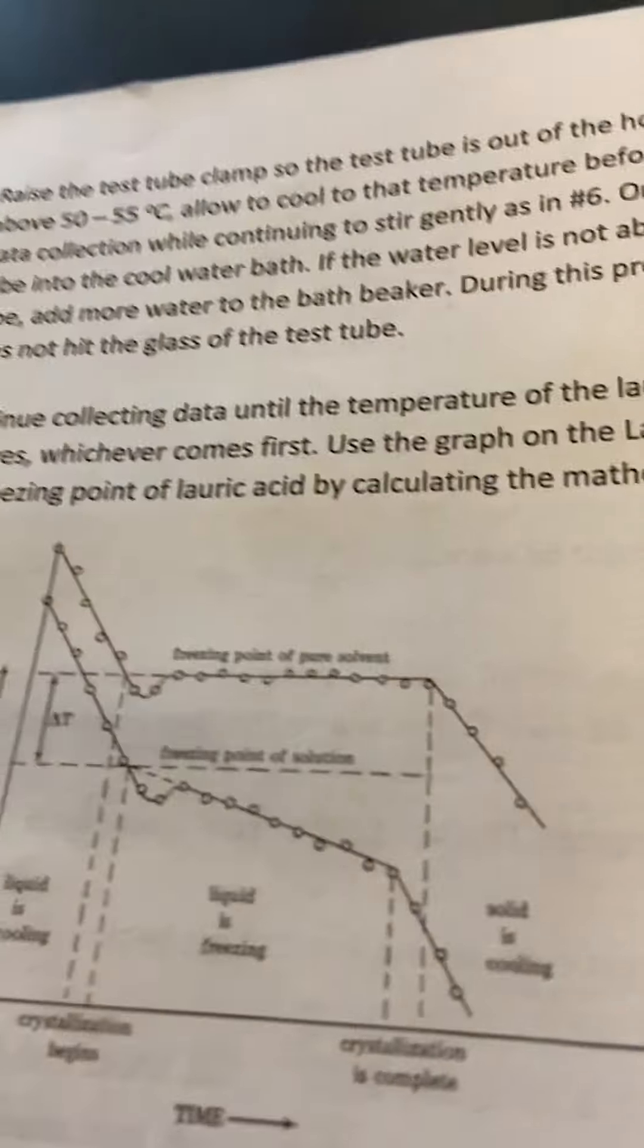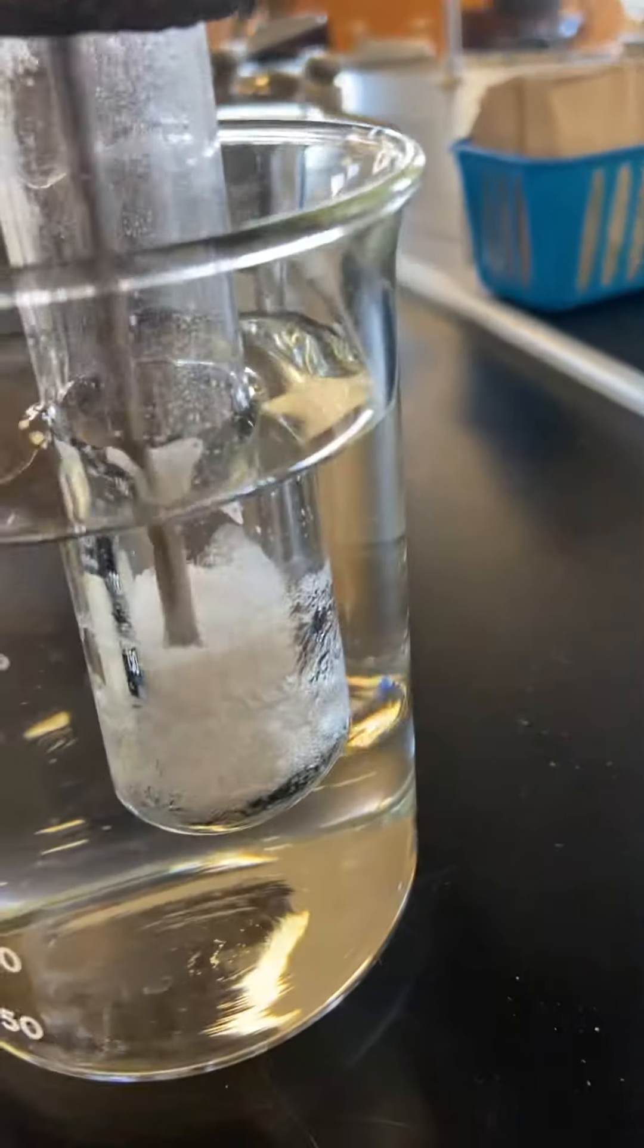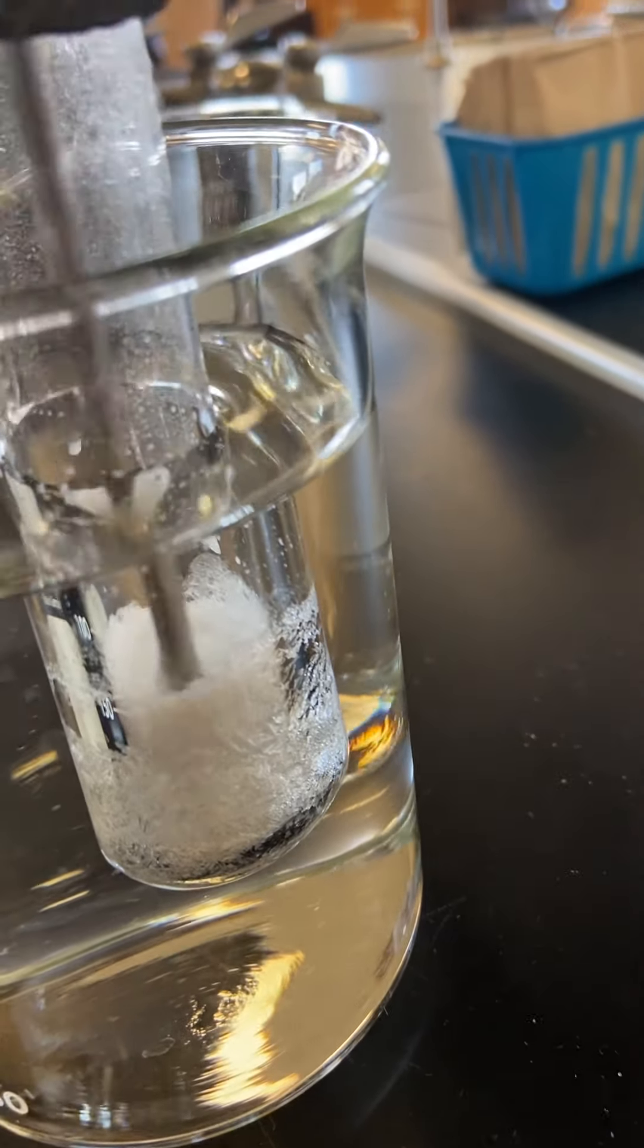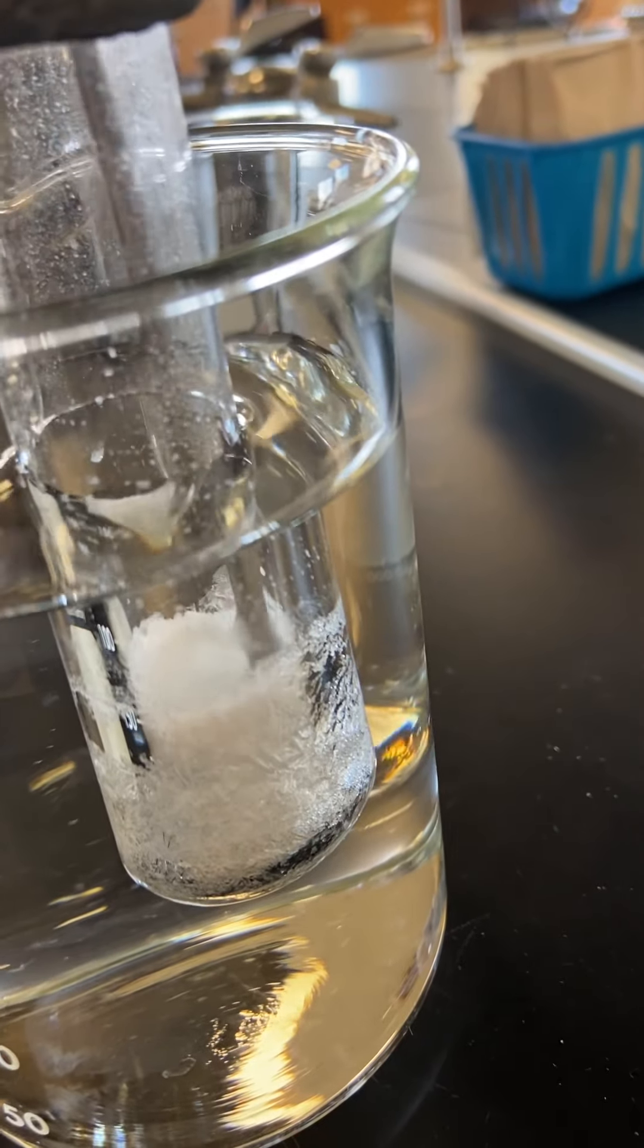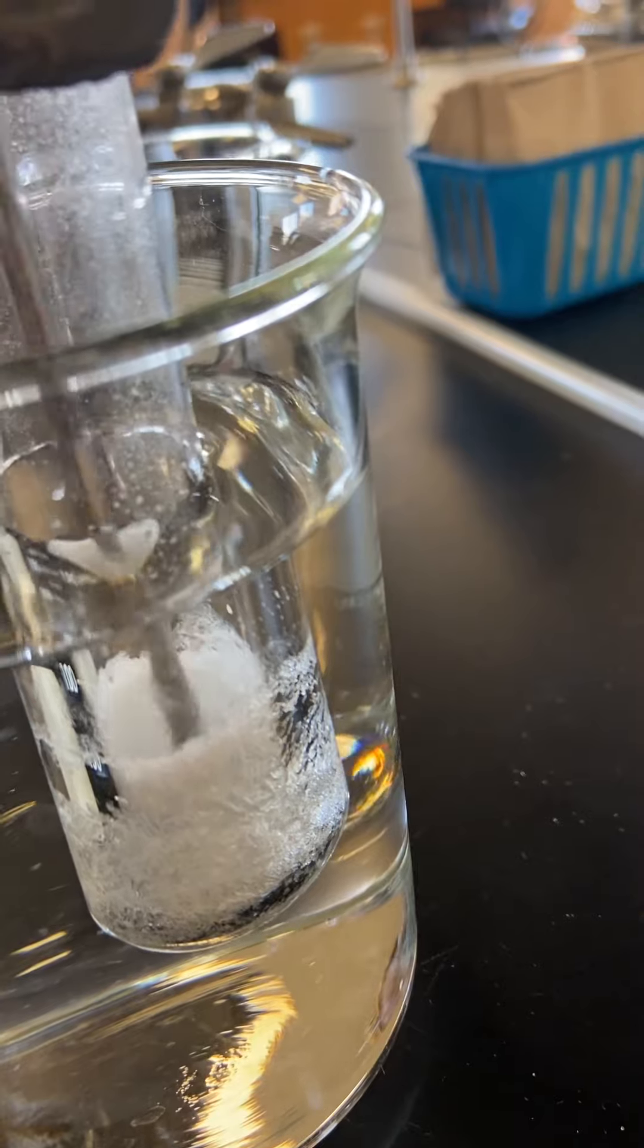According to the sample data, maybe collect data for another 30 seconds and then we can go ahead and stop. I think we've reached it. It's important.